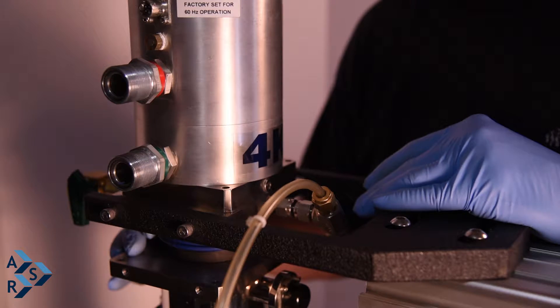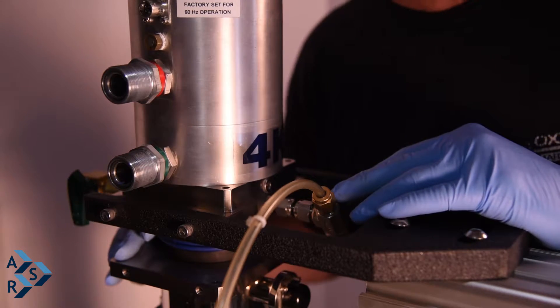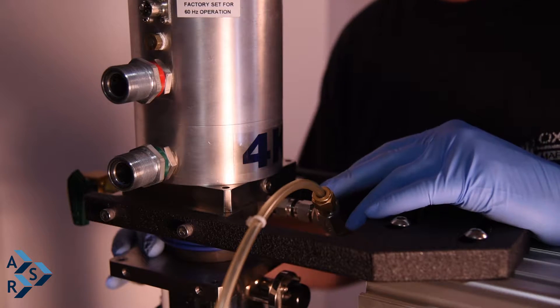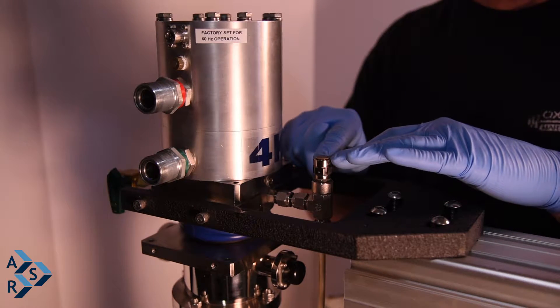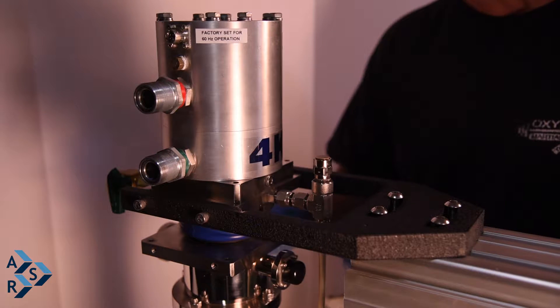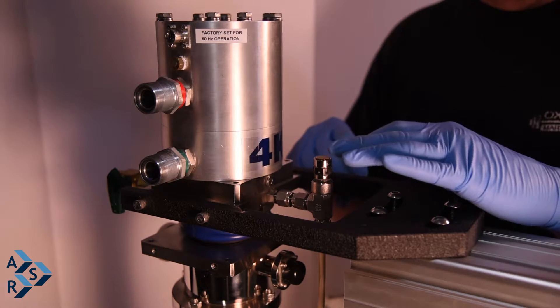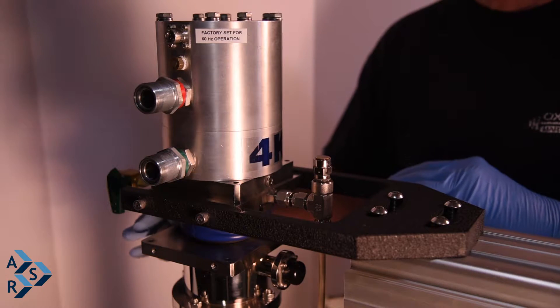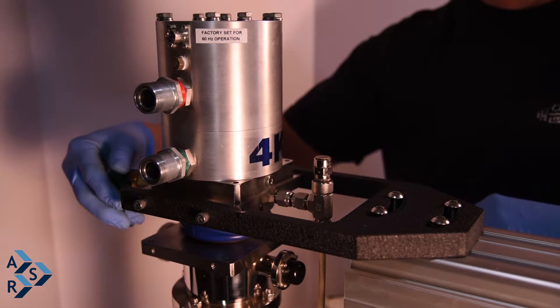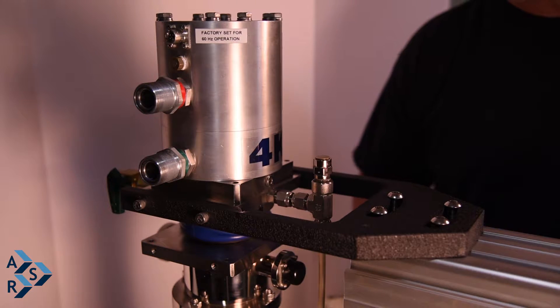You must maintain positive pressure from 1 to 5 PSI. We recommend five-nines helium gas, but if you use three-nines or four-nines, on the first cool down just leave a little positive pressure that lifts the relief valve slightly so it doesn't condense quickly and create a vacuum in the annular space. Once you get down below 20 Kelvin, back off on your regulator to ensure no pressure is coming out of your relief valve, but maintain enough to keep positive pressure in your bellows. Make sure the valve is fully closed — that will give you good stability for vibration and good conduction of the gas.